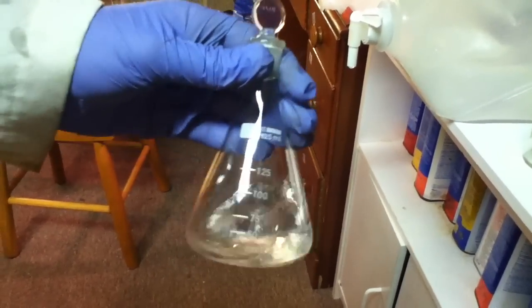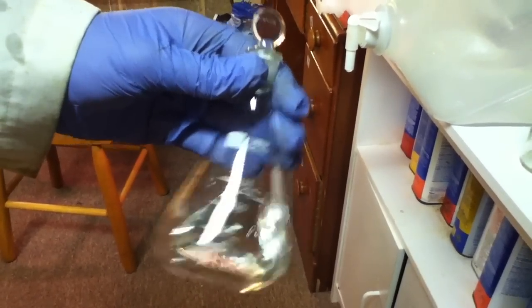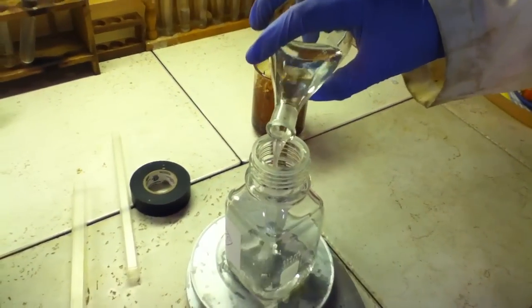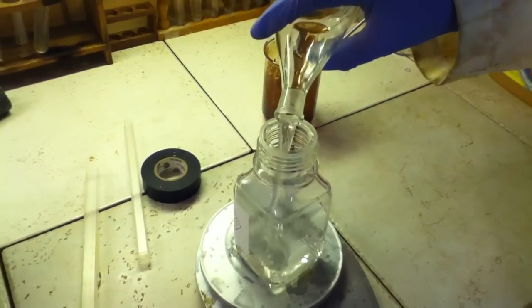Here is the distillate. The product was weighed and was found to weigh 55 grams. This was a low yield.